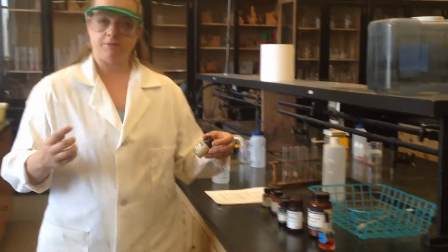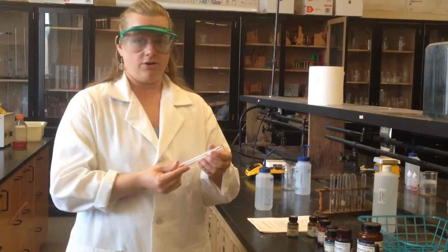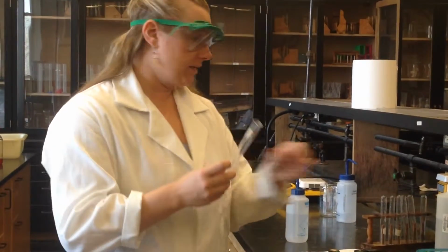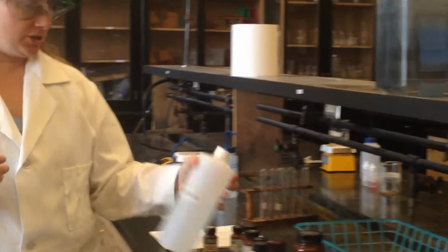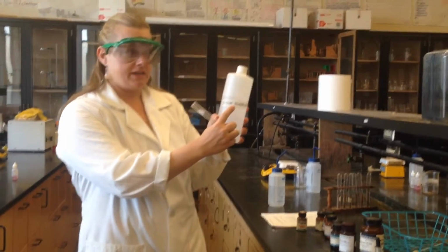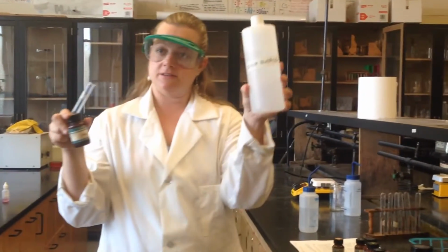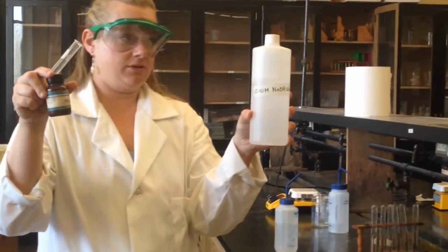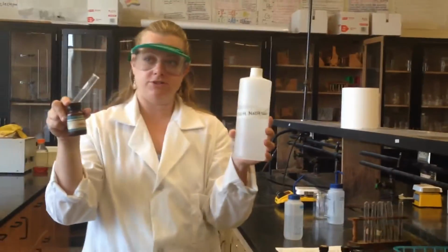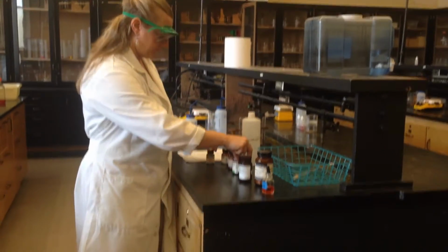Okay, so I'm going to just experiment with a couple different indicators. I want you to record the color of the powder, then the color in the water, and then the color when I add a base. Today I'm just going to use sodium hydroxide. Remember, anything that has an OH on it means it's a base. If this is an acid and this is a base, we're going to expect that a reaction has occurred. Now, most acid-base reactions are reversible, okay? So that kind of ties into our equilibrium. So we're going to see if we can get this to turn.